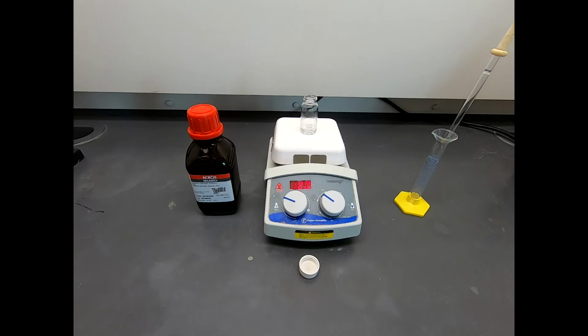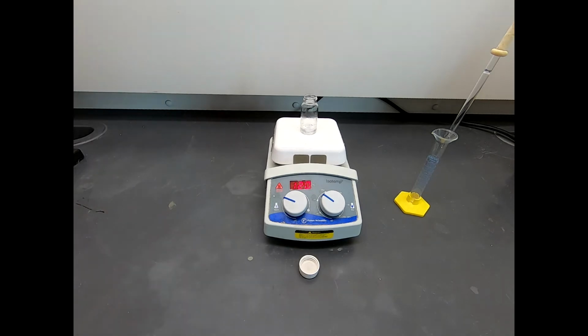Note that hydrazine is not the nicest material, so treat it carefully. I'm going to dispense it in this manner, but we're going to measure it as a volume. This solution is going to be measured out with a pipetter, and this pipetter only goes to 200 microliters. I need about 380 microliters of this reagent, and so I'm going to add it in 2 portions, 190 microliters each. There's 1 portion. And here comes the second one.